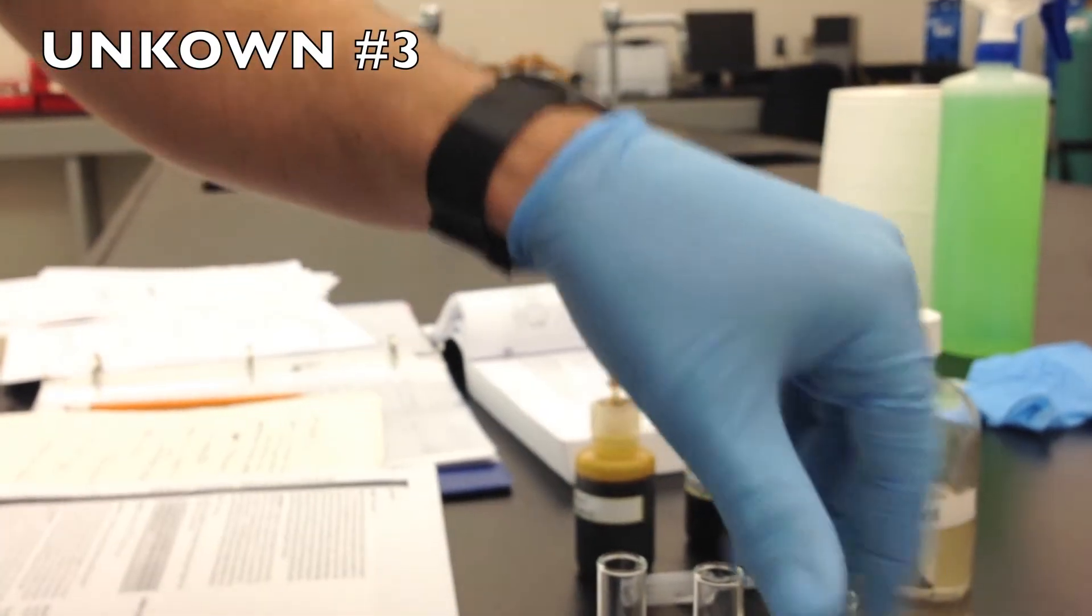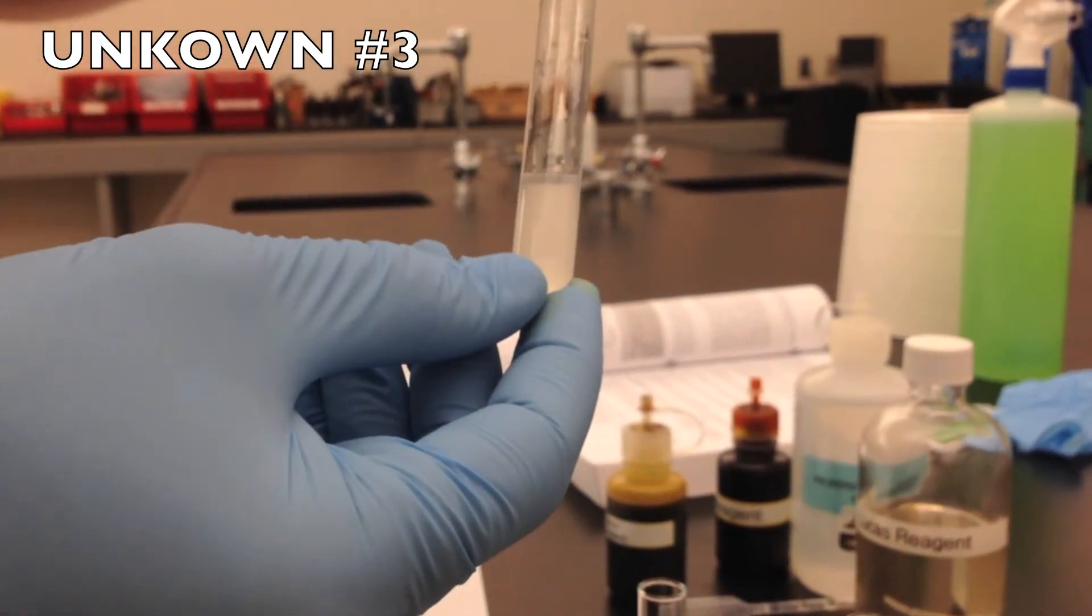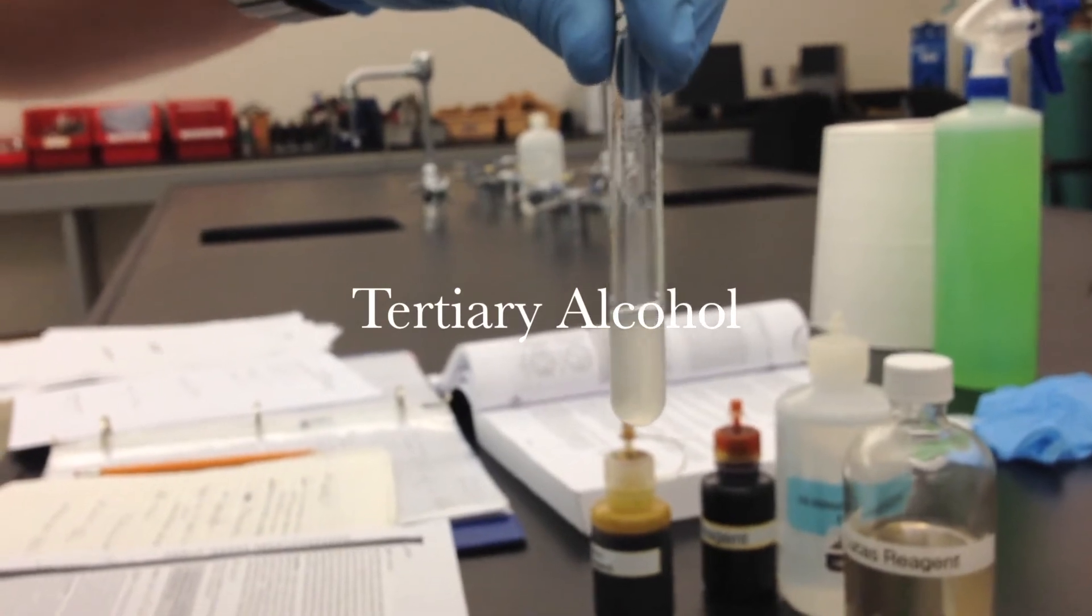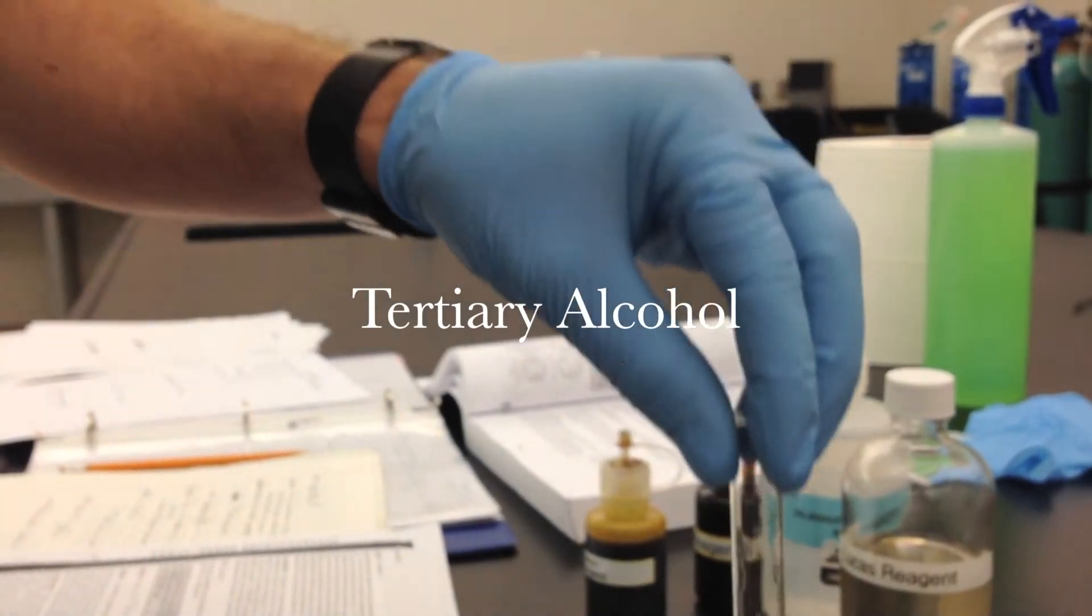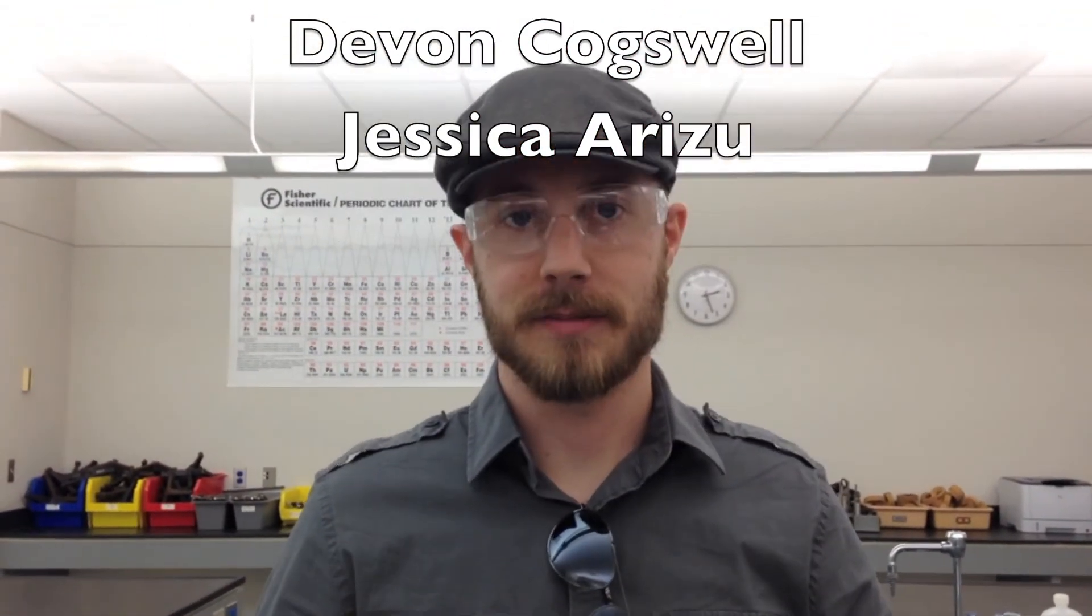So if it is not a primary or secondary and it proved positive for a secondary or tertiary, then we know it is a tertiary alcohol. Now everyone follow your OSHA protocols when you are disposing of any hazardous materials and when cleaning your workstation. Thank you.